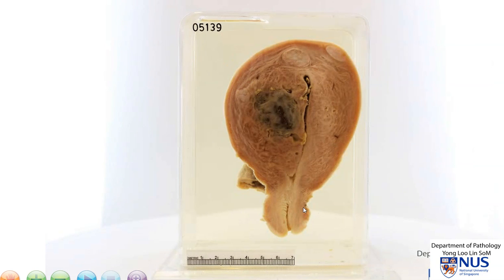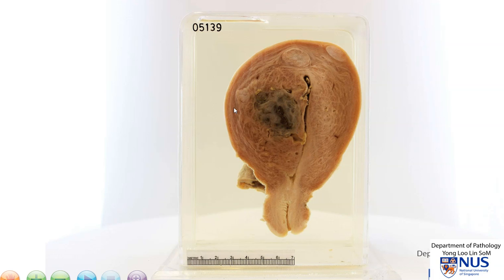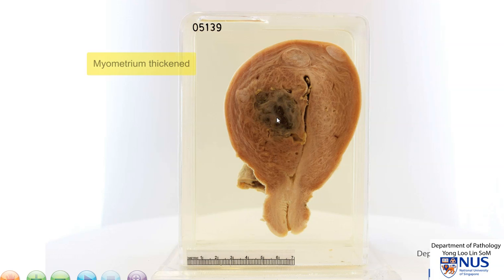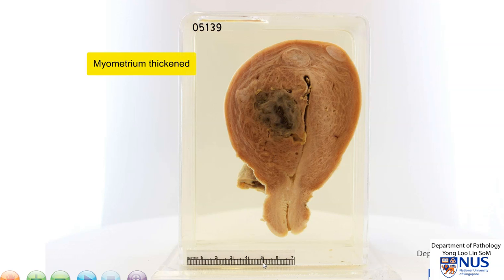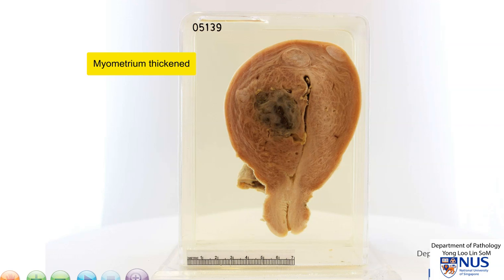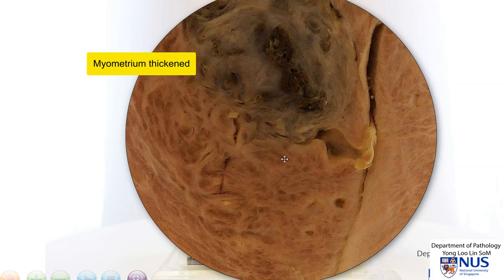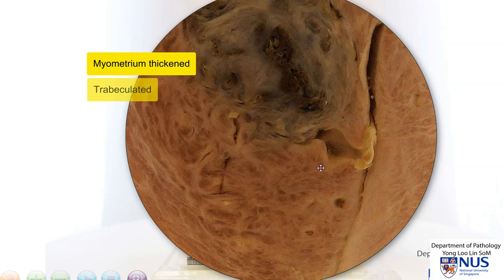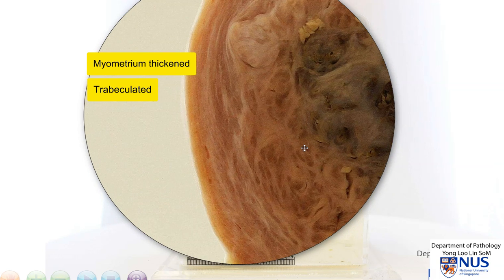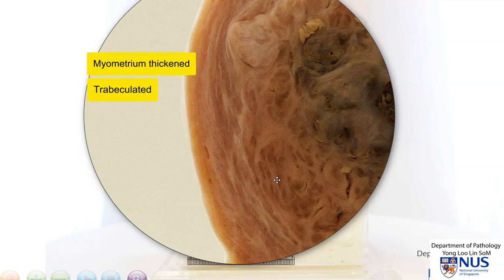Coming back to the cut surface, the main pathology lies in the myometrium, and we can see that it is expanded and thickened up to almost five centimetres thick in this region. When we take a closer look, we can see that the myometrium is rather trabeculated. It has all these branching pale lines running through, as opposed to the usual myometrium where the lines are a little bit more parallel.